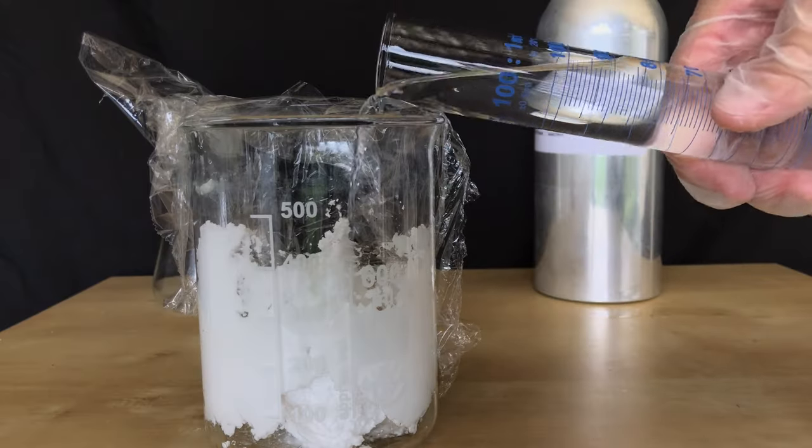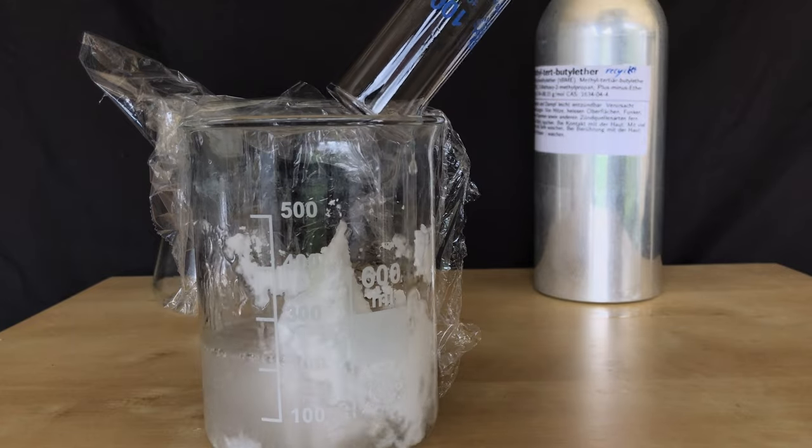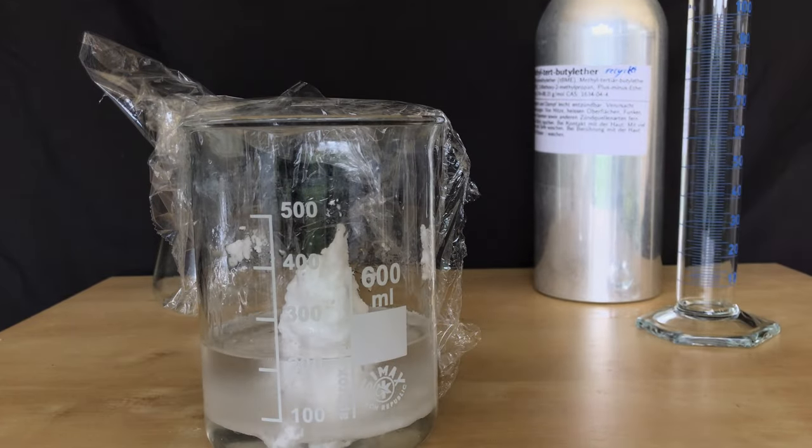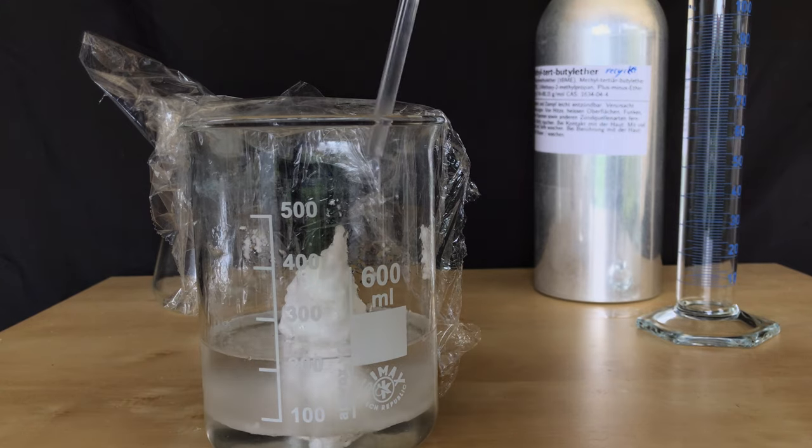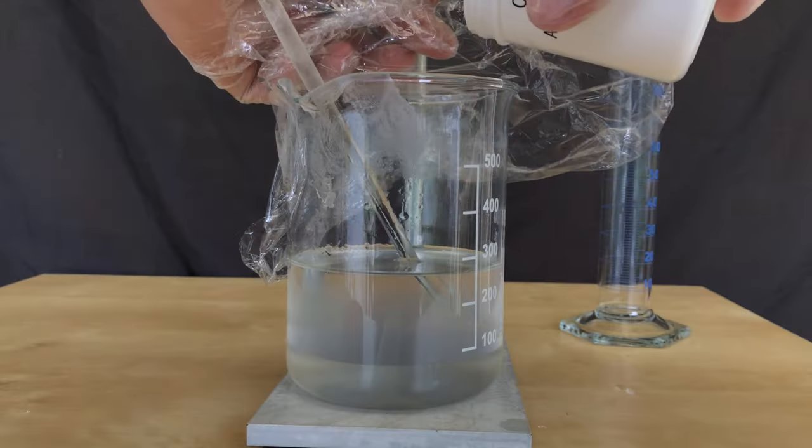The product still contains a lot of water and therefore we added some MTBE to dissolve the product while leaving the water behind. It was mesmerizing to watch how quickly the isoborneol dissolved in the ether.